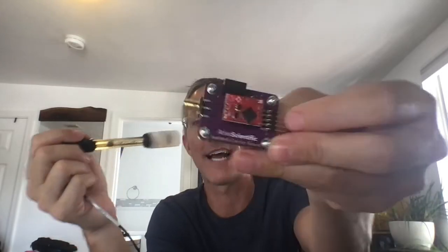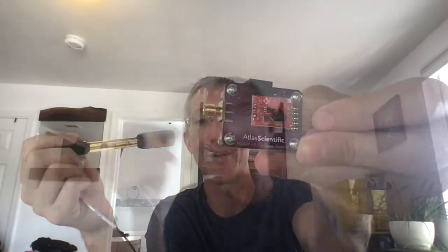Hi, I'm Ryan, and I really like using this sensor. This is the Atlas Scientific pH sensor with its isolated carrier board, and what I'm going to show you is how to switch between read modes from UART to I2C and I2C to UART.